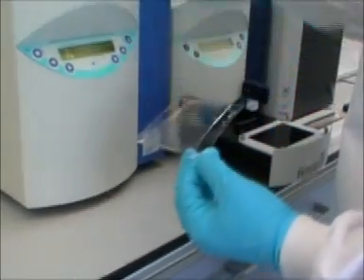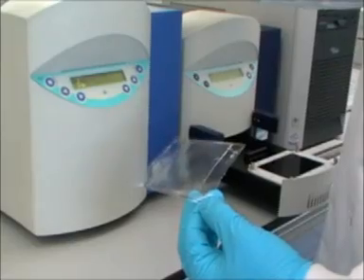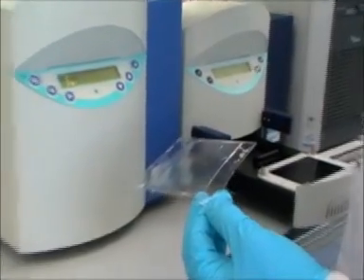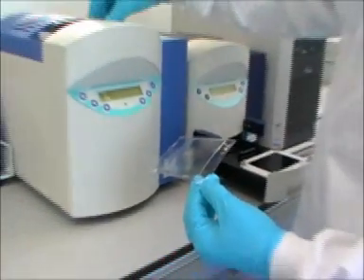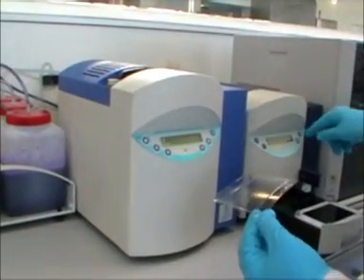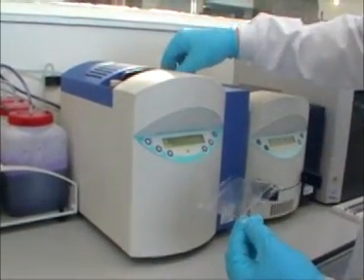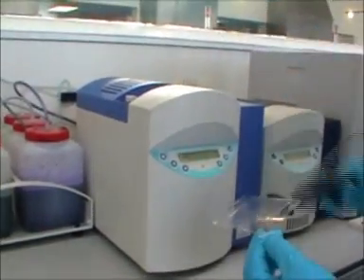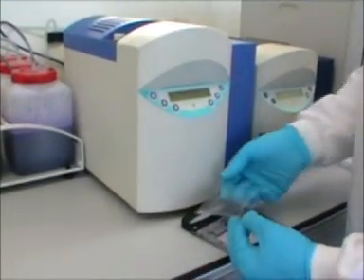The gel on its plastic backing is lifted carefully and set in the metal holder of the stain destain unit.